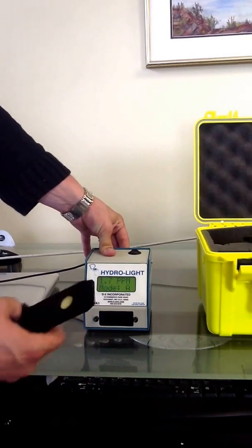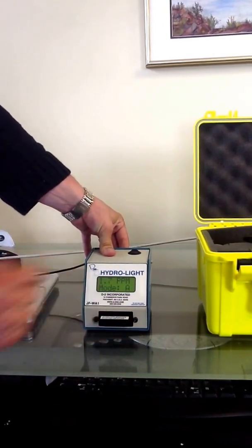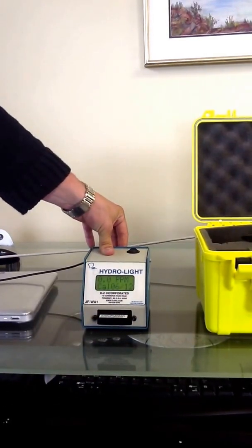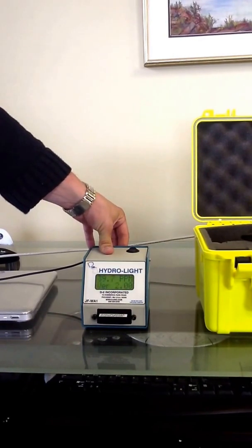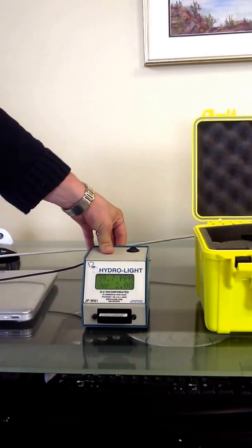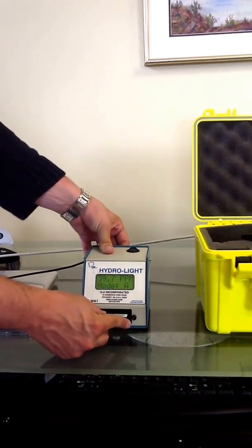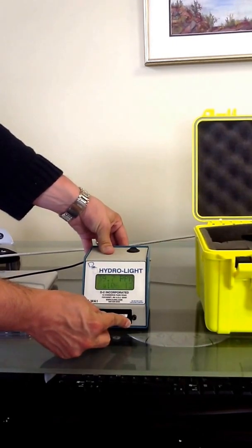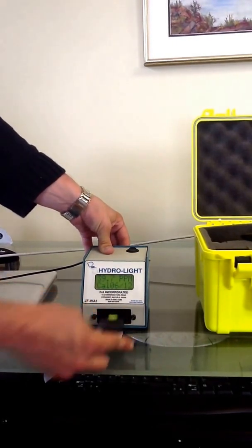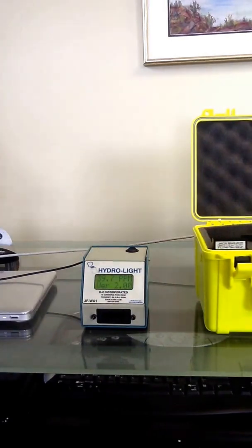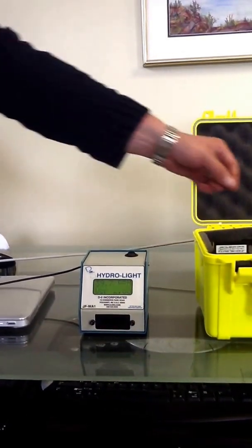We flip it over, check the high side. It's going to take three seconds to take a measurement, and then we're going to get 39.7 parts per million, which is only 0.7 over the 39 reading, which is well within the plus or minus 3 parts per million. So now we know that the device is fully calibrated, so we can go ahead and make a test pad.